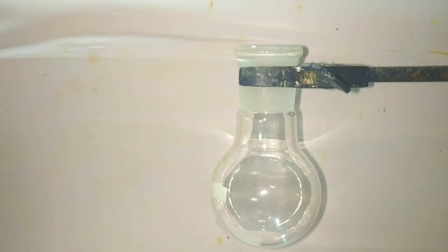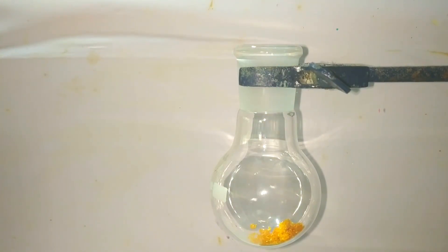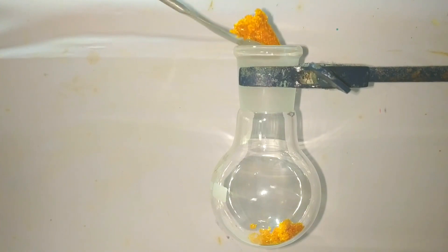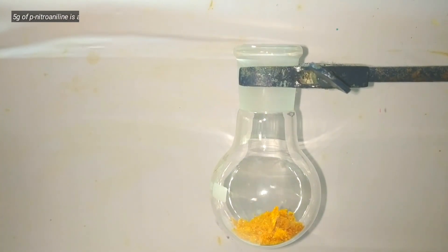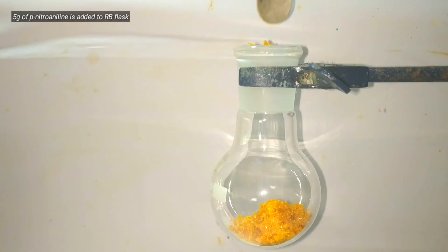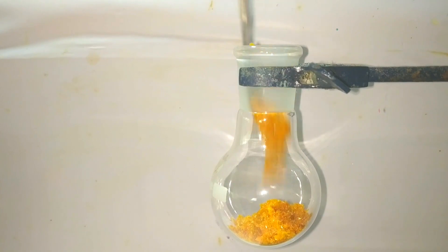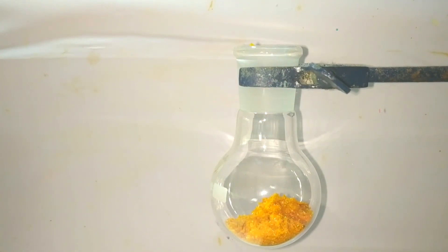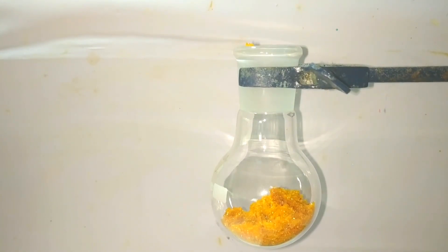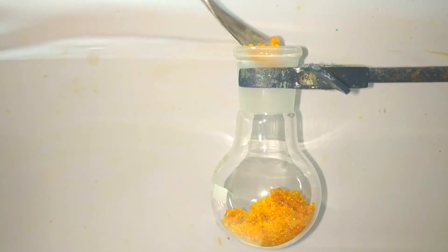Start by fixing a small 50 milliliter round bottom flask on a stand and then start adding the 5 grams of paranitroaniline into it. The paranitroaniline I am using was synthesized in one of my previous videos — you can watch that first to learn how to make this compound. It has this yellowish orange color to it. We need a total of 5 grams and I am adding it slowly with my spatula, making sure nothing spills.